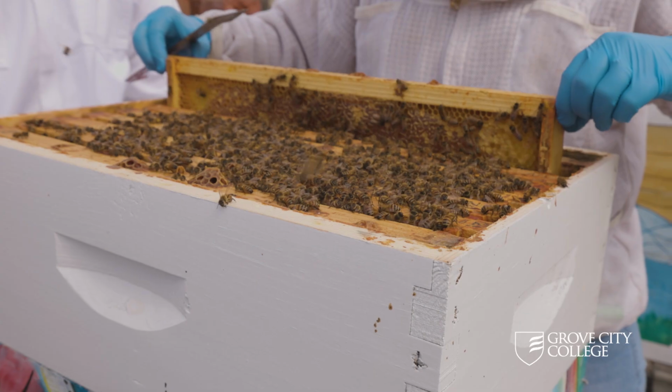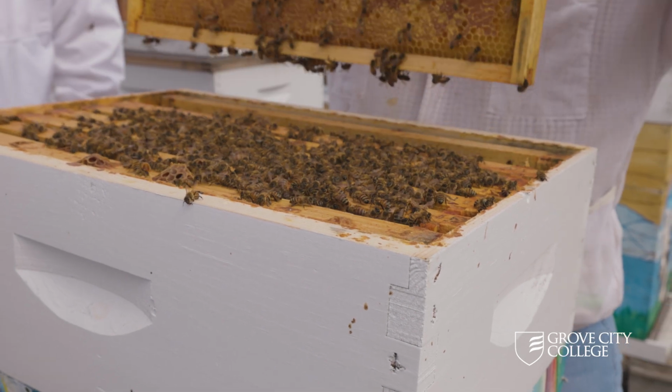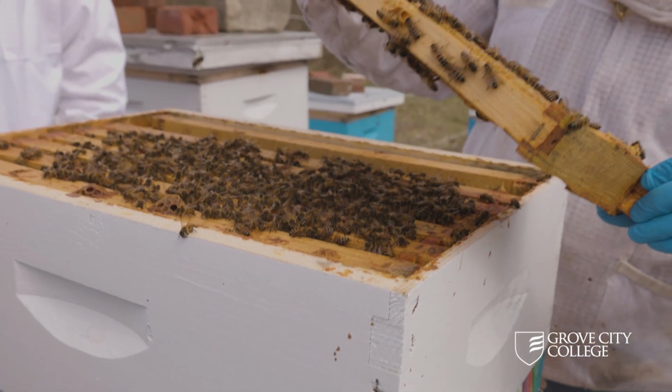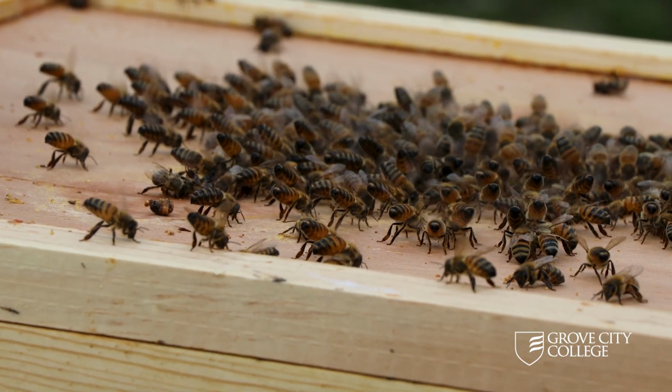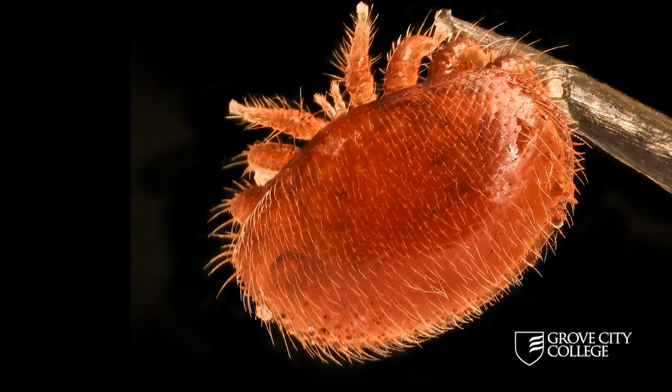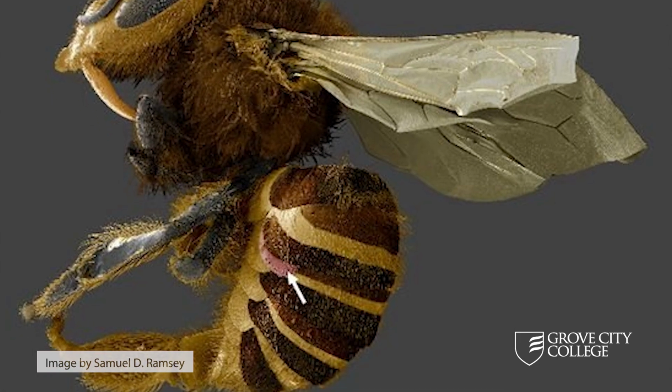We are working on deformed wing virus testing, and we're developing ways to make sure that our test works and that we can get accurate results. Deformed wing virus is an RNA virus that is commonly found throughout honeybee colonies, and there really isn't a whole lot of data available. Deformed wing virus causes a lot of physical deformities, like their wings get all shriveled. Varroa are the vector that transmits this disease to the honeybees.